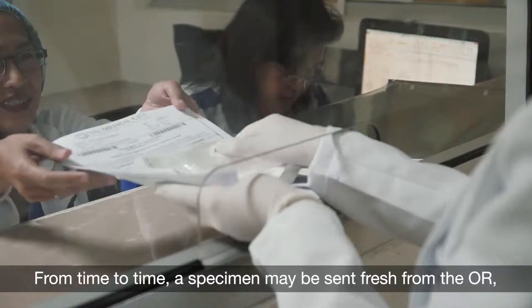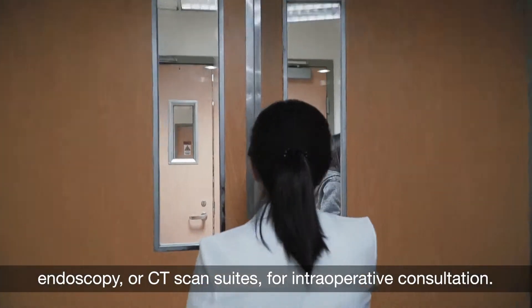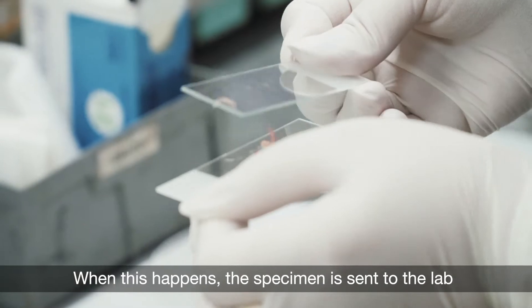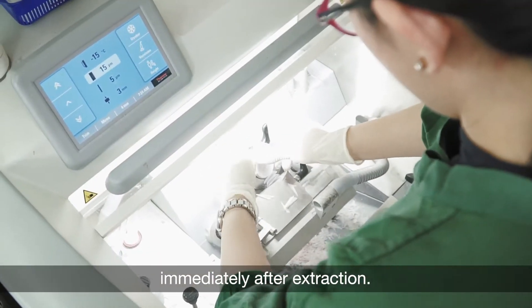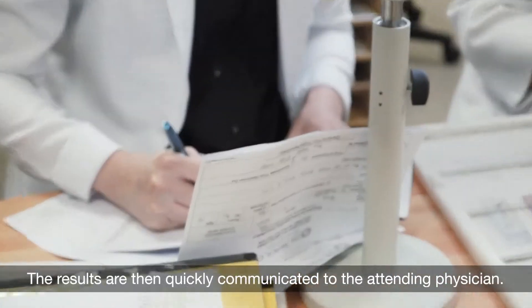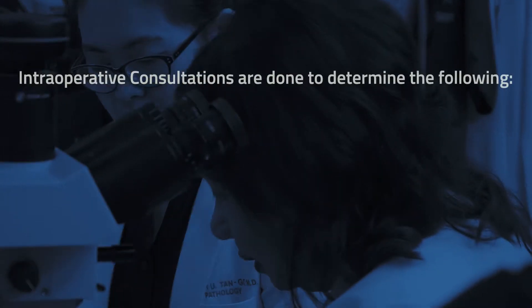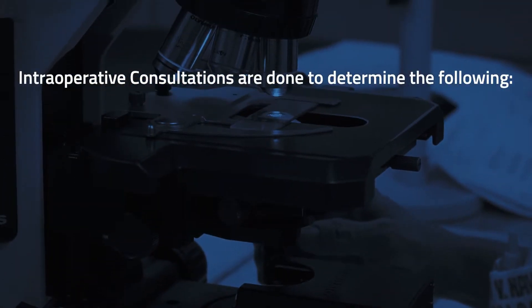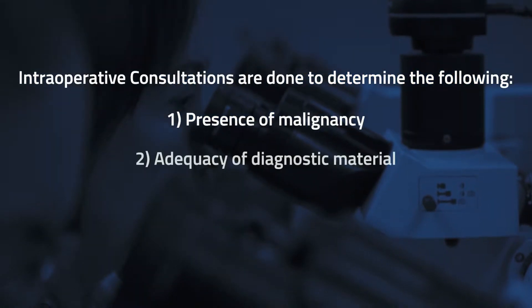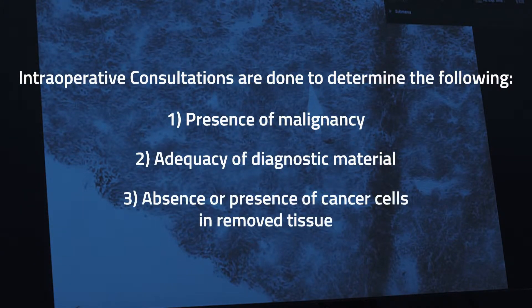From time to time, a specimen may be sent fresh from the OR, endoscopy, or CT scan suites for intraoperative consultation. When this happens, the specimen is sent to the lab immediately after extraction, where it is frozen and then evaluated in real time. The results are then quickly communicated to the attending physician. This kind of consultation is scheduled in order to determine the presence of malignancy, the adequacy of diagnostic material, and/or to see if all the tissues with cancer cells were removed during surgery.